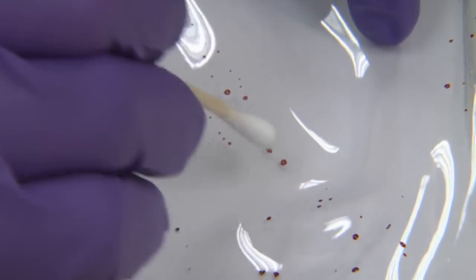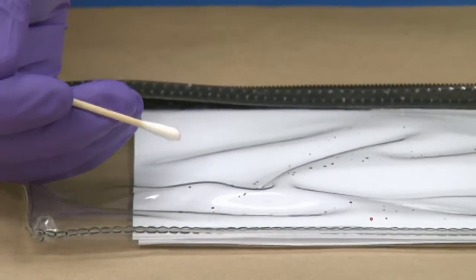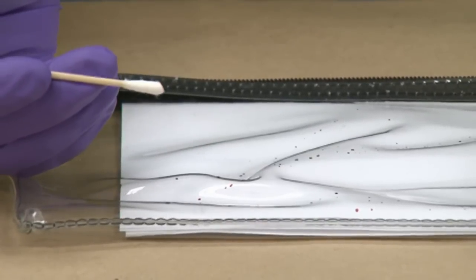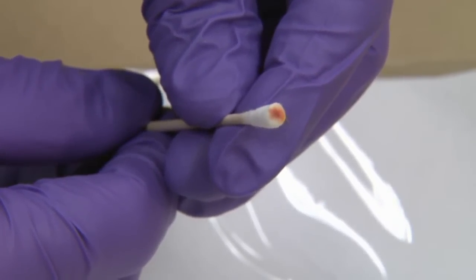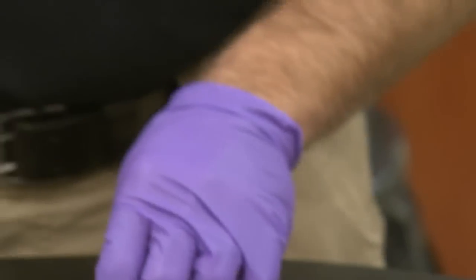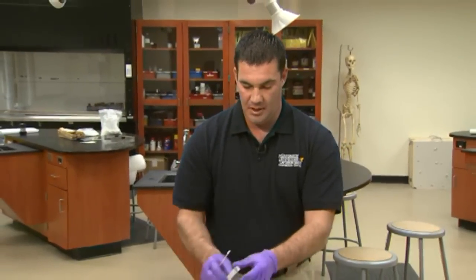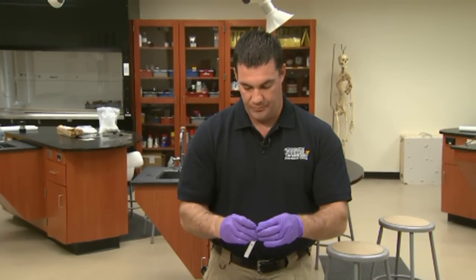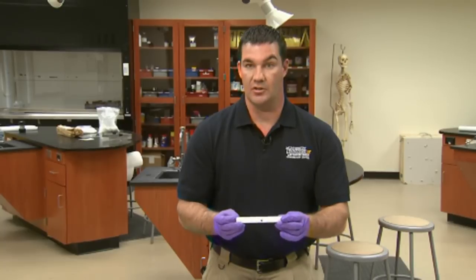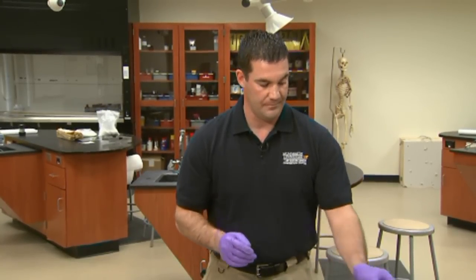If you have a scenario where you have several different drops as part of the same pattern, you could collect those together. But if you're down to just a single drop, you can see that you can concentrate blood on the end of that swab very well just doing that. Same scenario as before — make sure the swab box is filled out prior to collection, place the swab into the swab box, then package it into paper — never plastic — and label and identify it.